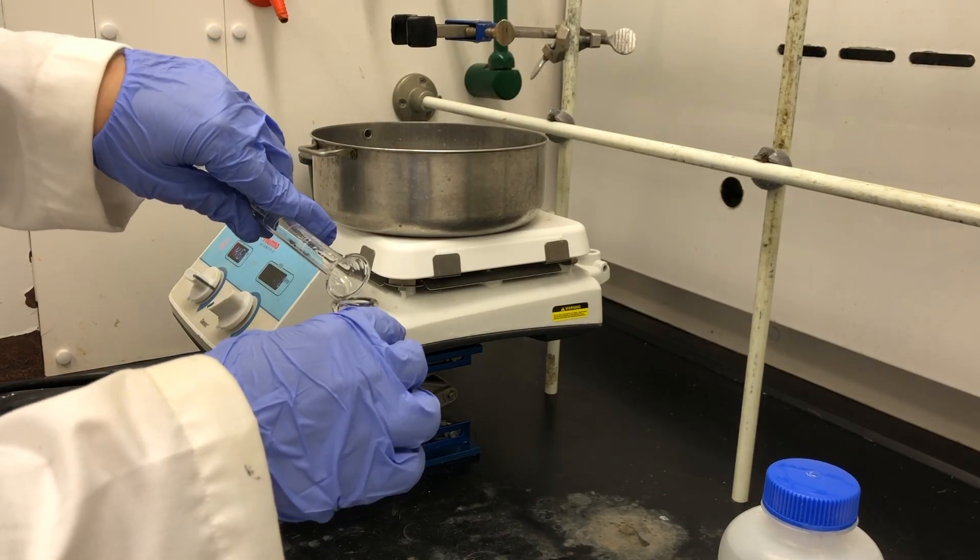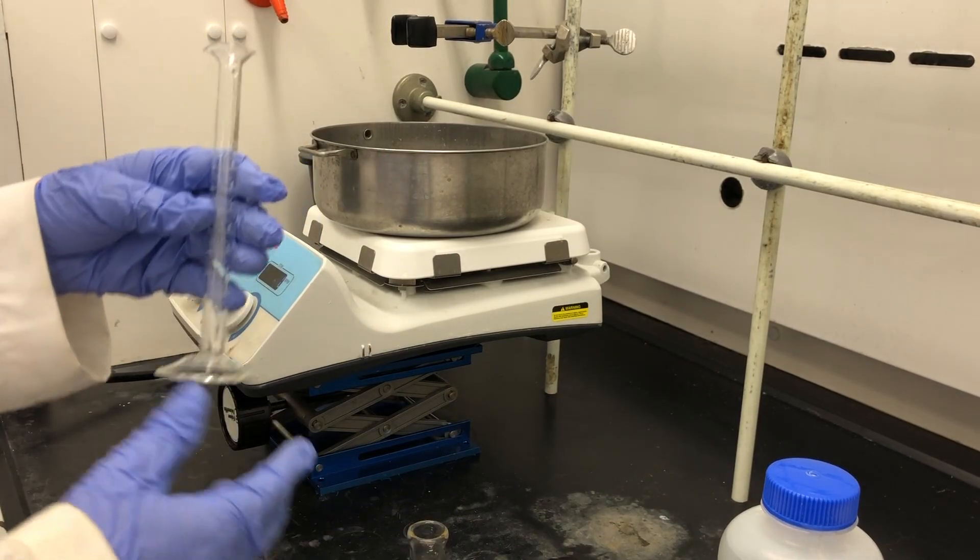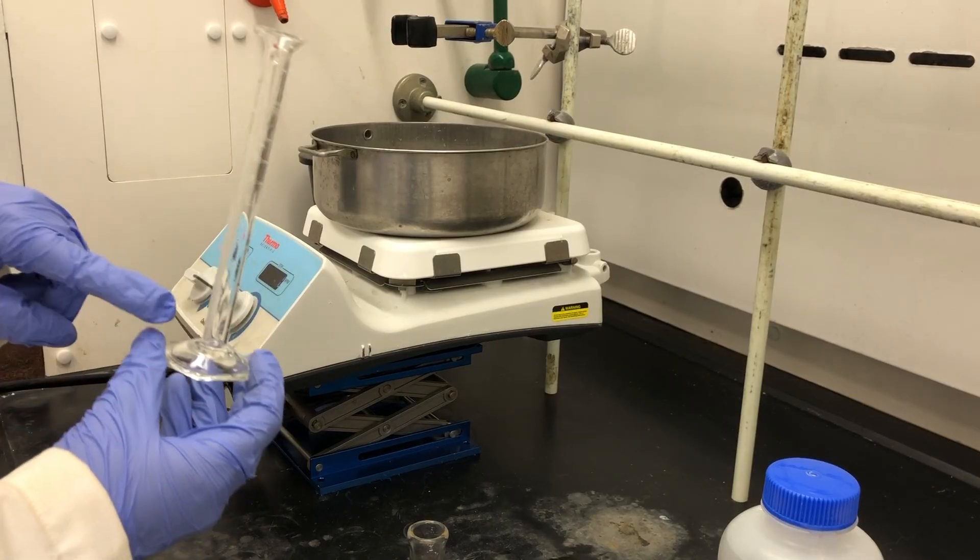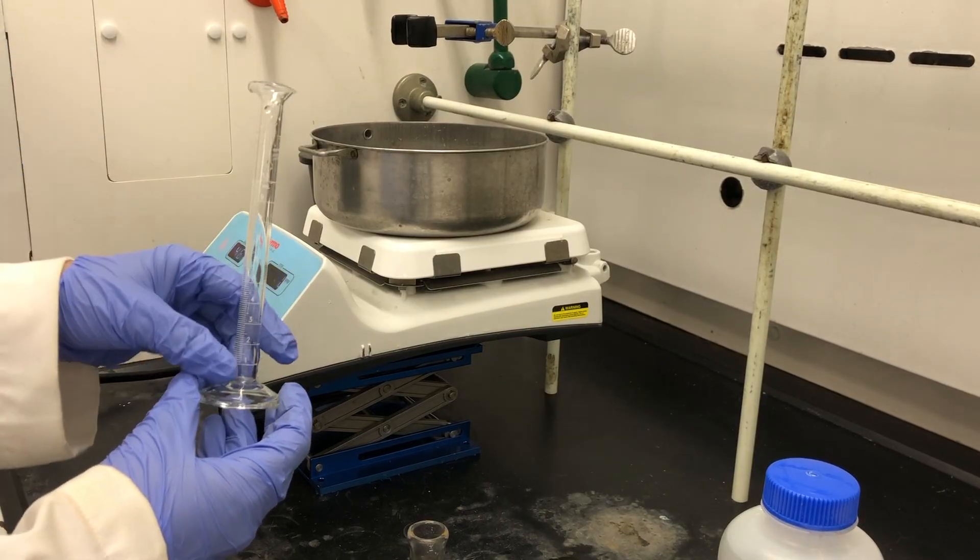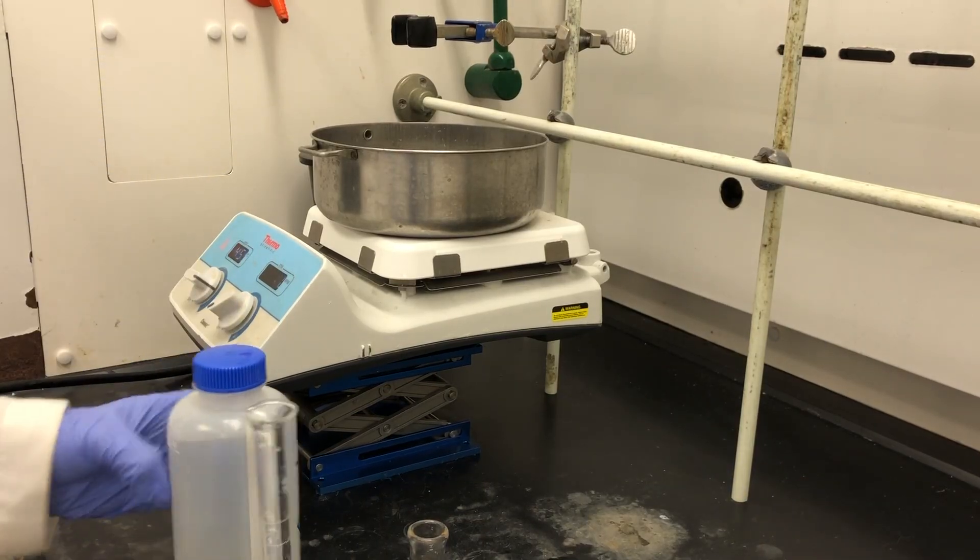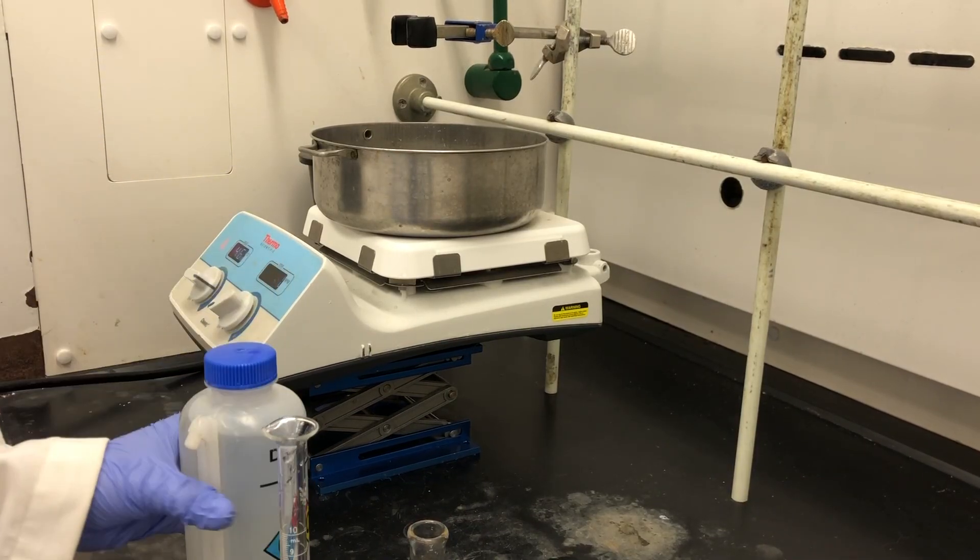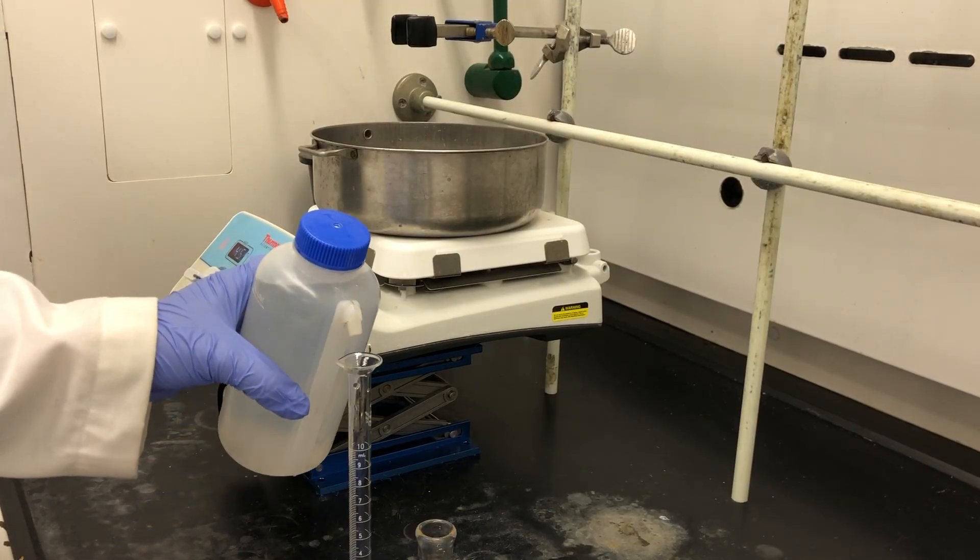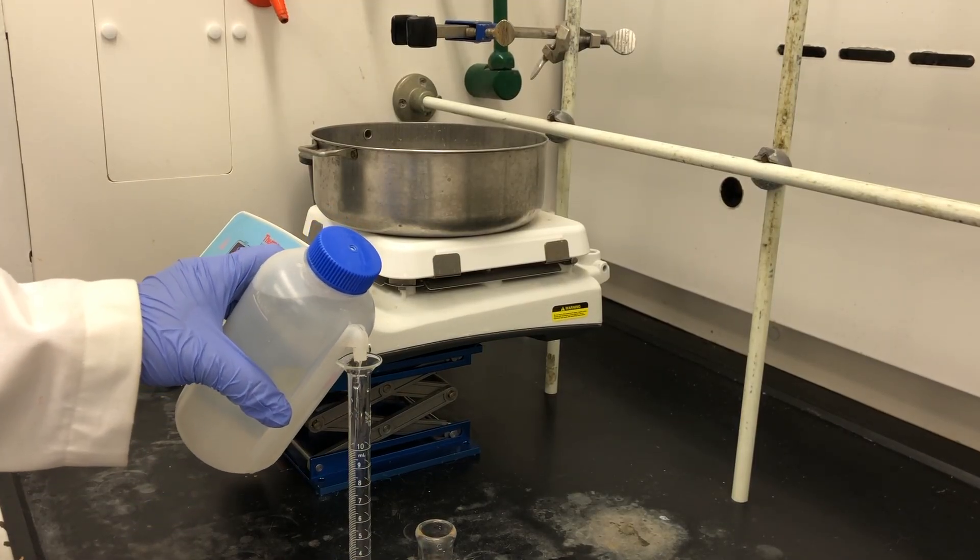We're going to dissolve the reaction mixture in water. We need 8 milliliters of deionized water. I can use the same graduated cylinder since I'm adding water to the same reaction mixture. Go ahead and fill it to about 8 milliliters.